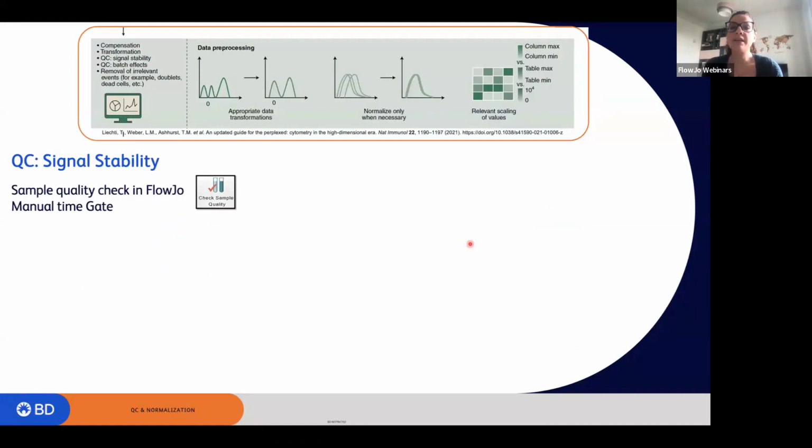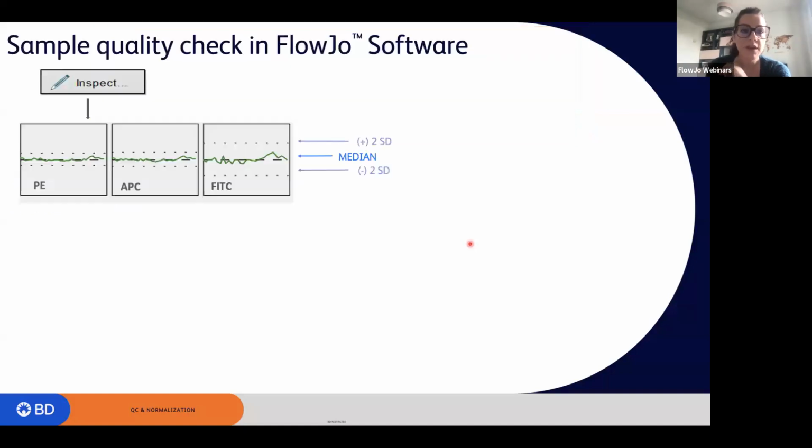So what else can we do within FlowJo? There is a default tool within FlowJo that allows you to inspect the files. If you click on the small circle next to your FCS files and double click on it, that will allow you to inspect the specific file. And what it will do is plot the median of each parameter versus time.